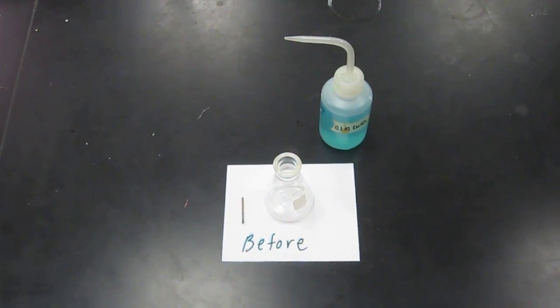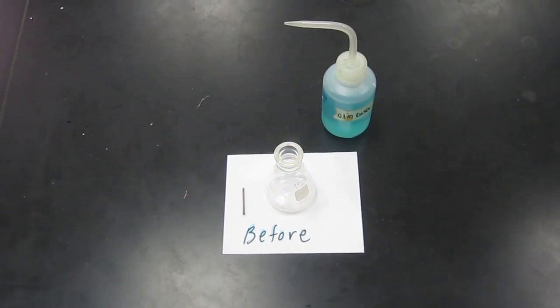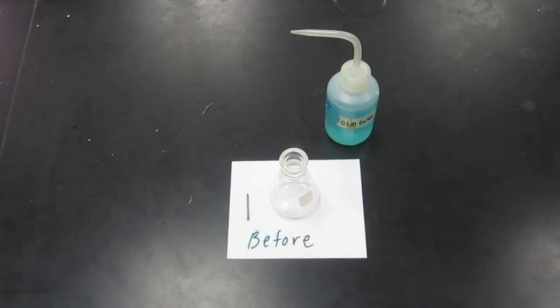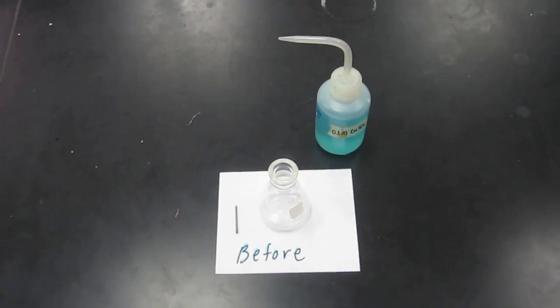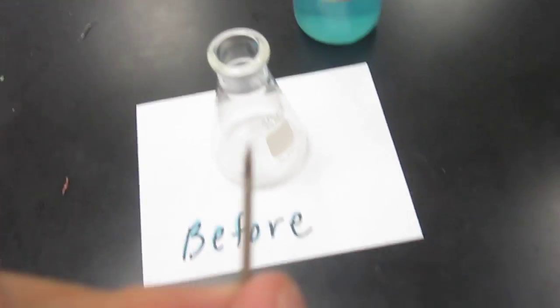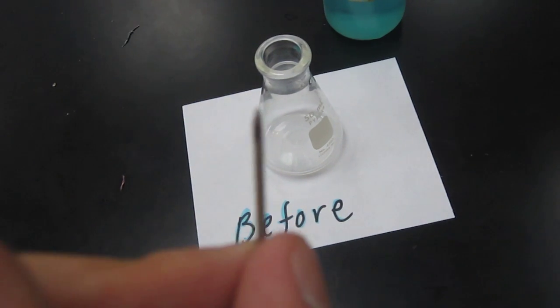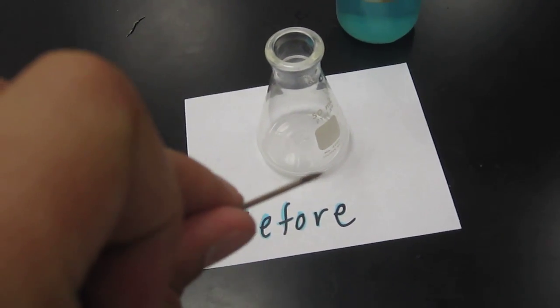This recording is of before and after using iron and reacting it with copper sulfate solution. There's the copper sulfate solution. There's the iron. I see a clean nail.